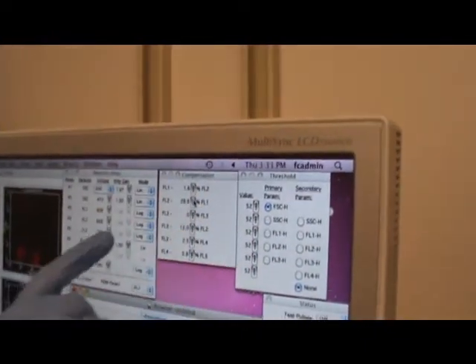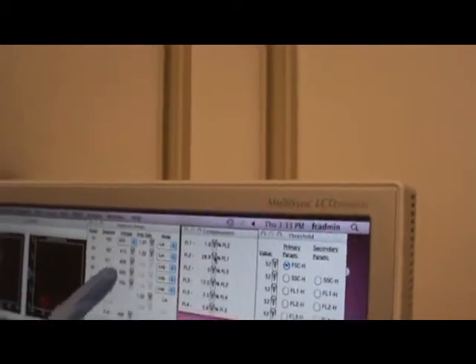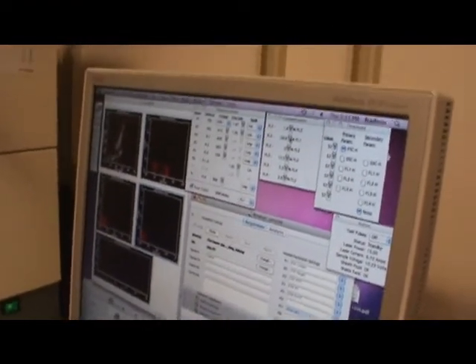So, whether it is between FL2 and FL1, if it's FITC and PE, you will be adjusting these two numbers. Now I'm putting PE. I'll show you. That's why I made this experiment, so that you understand, because with your one color experiment, you will not understand anything that's present or not. But this makes you understand the whole concept.